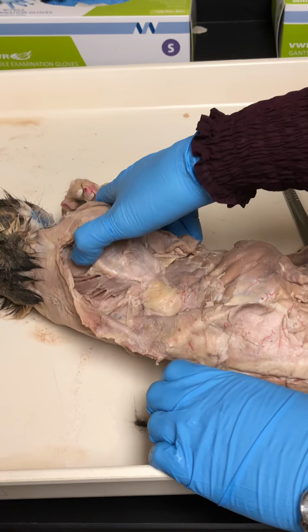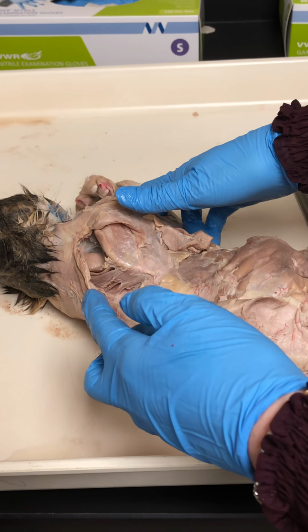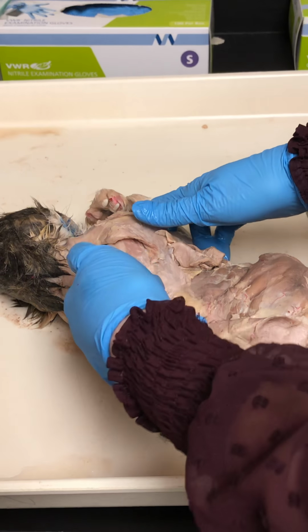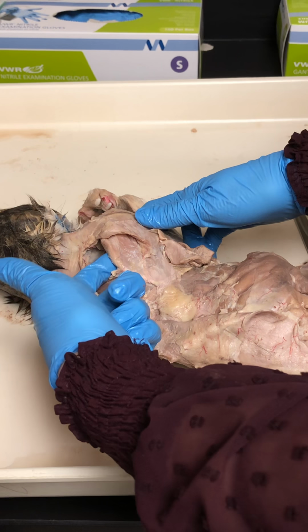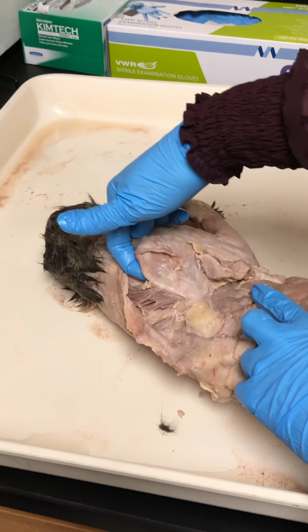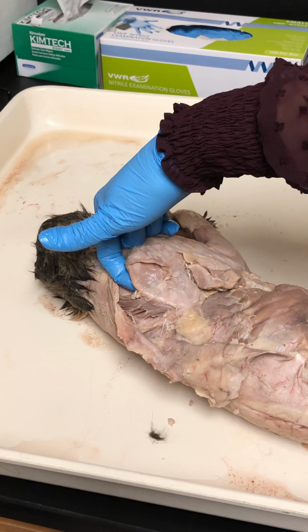Makes sense. Okay, moving to the anterior thorax and the abdomen. Okay, serratus anterior. Wait, did we do subscapularis? Did that, it might not be on your list. It's not on our list. It's going to be in the subscapular fossa, so on the underside of the scapula. Okay, so it's going to be here. So you have supra, infra, and sub underneath.